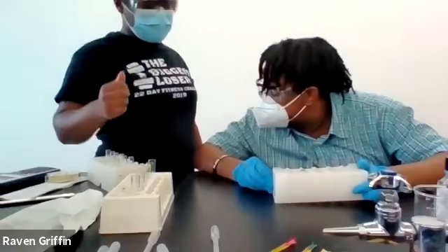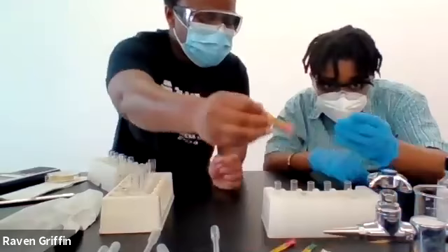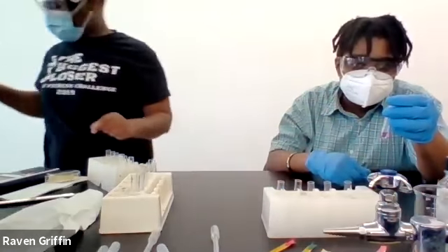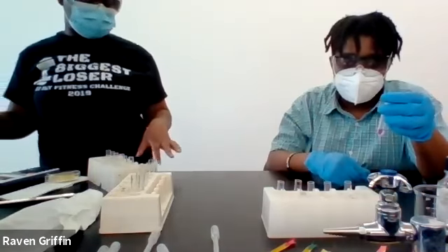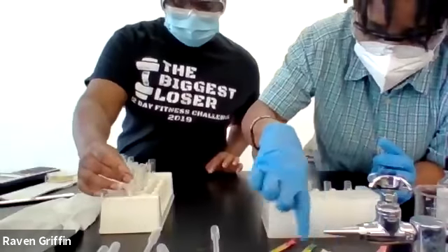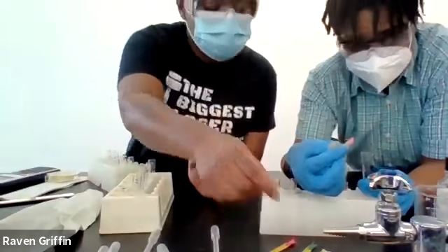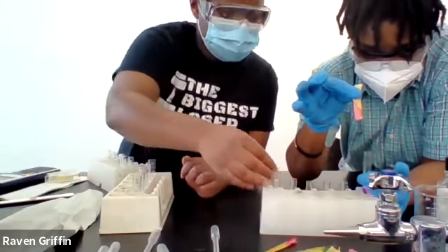Thank you. So these are still in order. So the color, oh, you didn't add indicator for this one. Oh, 1, 2, 3, 4, 5, 6. This is the order. Oh, okay, I didn't know about the color. Well, that was part of that. Oh, it was the same. Okay, so yeah. HCl turned reddish.